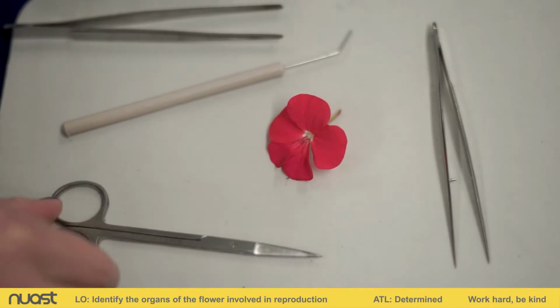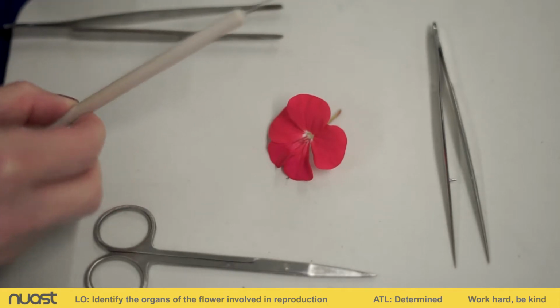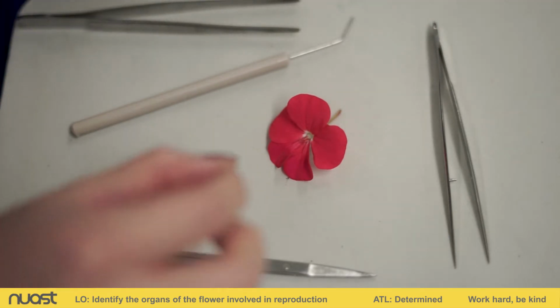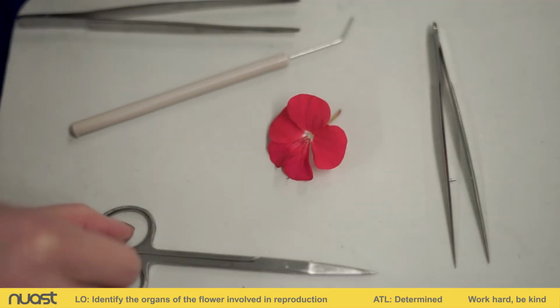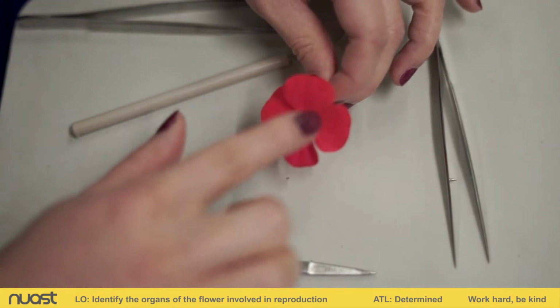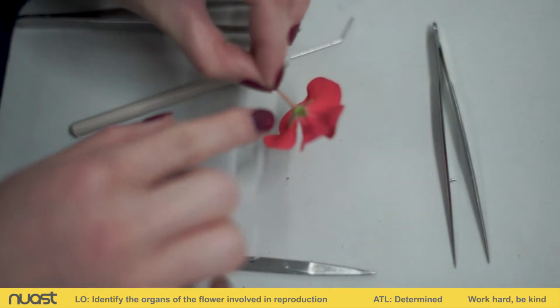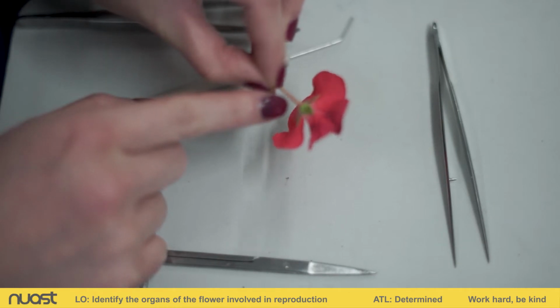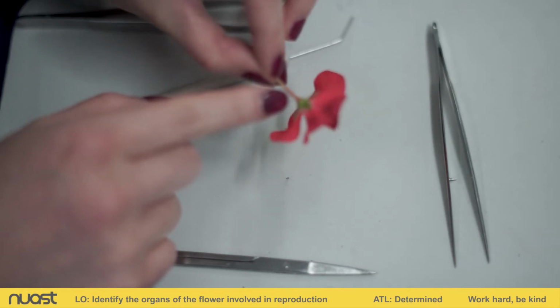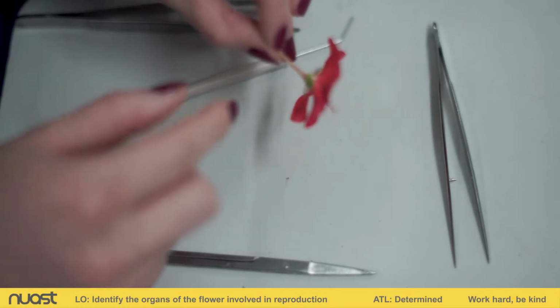I have my scissors, a probe for pointing at particular organs within the flower, and my forceps that I can use to pull apart certain organs. Now, with the flower, we can see that it has lovely bright red petals, and beneath the flower we can see the sepals. Not all flowers have sepals, but the purpose of the sepal is to protect the petals of the flower whilst it is growing.